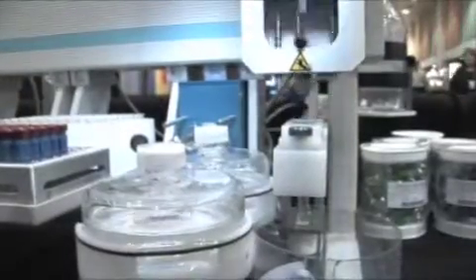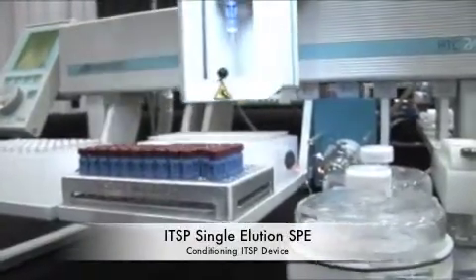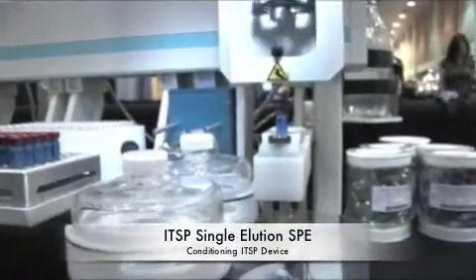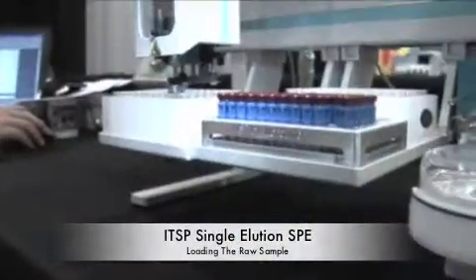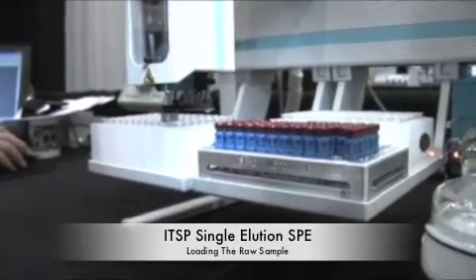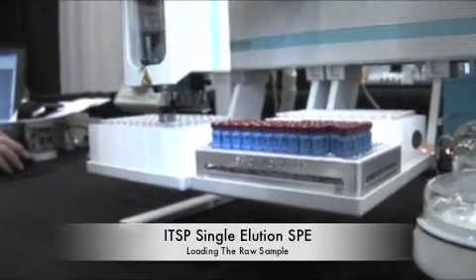So the idea is to be able to pick this device up and move it anywhere on the platform to perform your conditioning steps, your loading of your raw sample, and then your final elution and injecting onto the valve. So what you see now is we are fixing to load the raw sample. It can be from a closed vial, it can be from a 96 well plate, just about any source, an EPA vial. You just have to have the tray designated for that size.